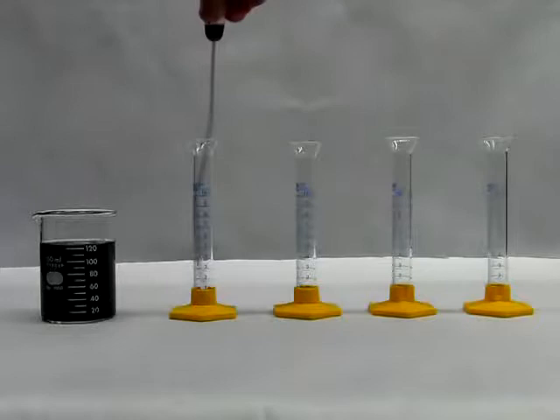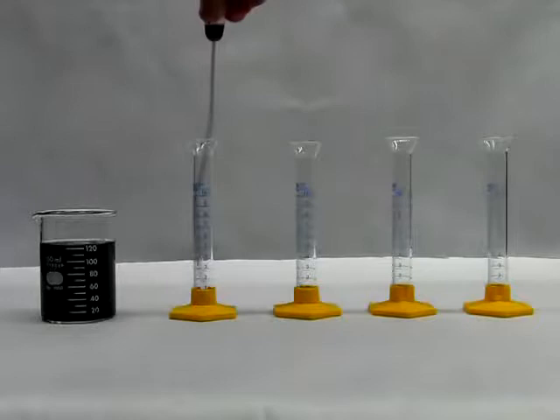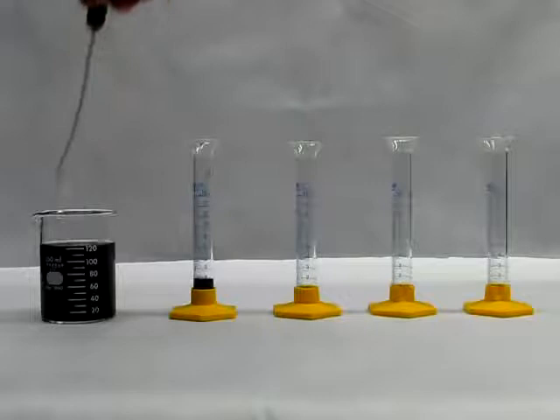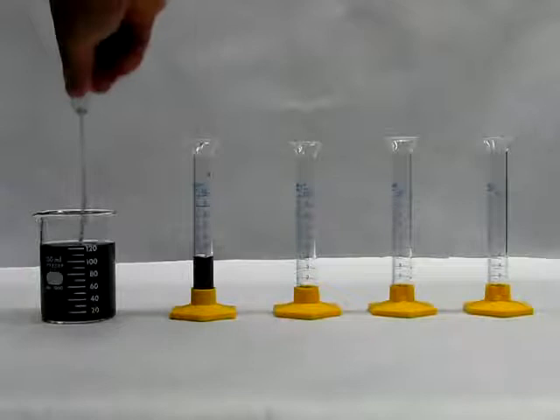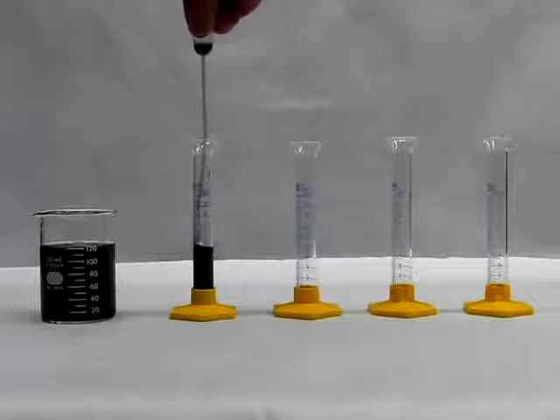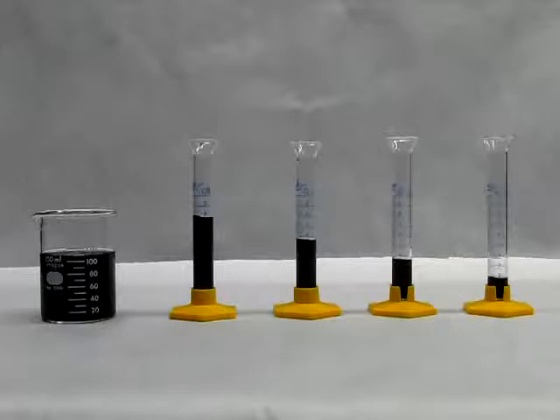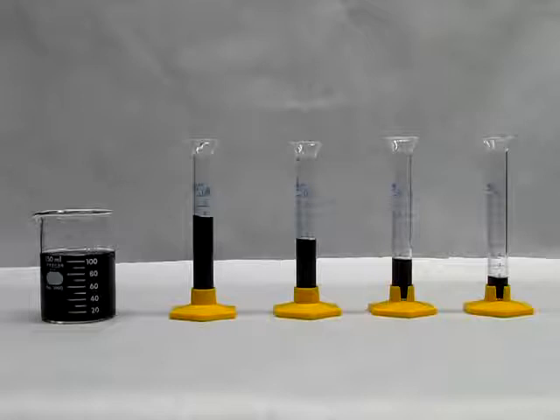On the left, we can see our stock solution which is very concentrated. From that solution, we will take different volumes and put it in every one of the graduated cylinders. What we are showing here is just an example. You will have to find the correct volumes that work for every sample.